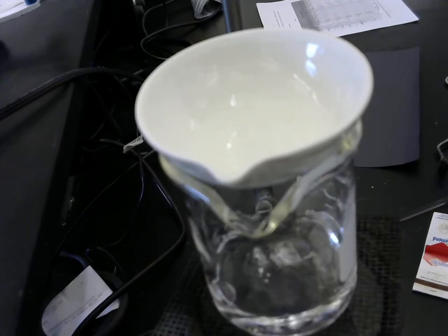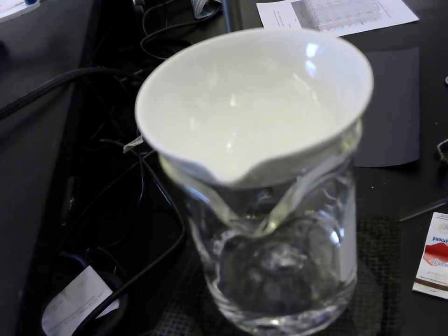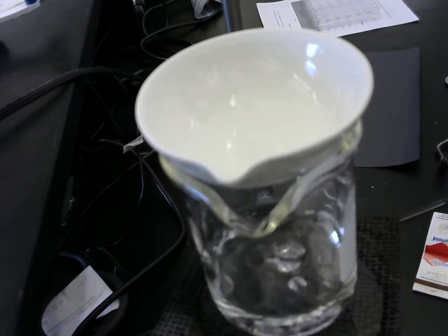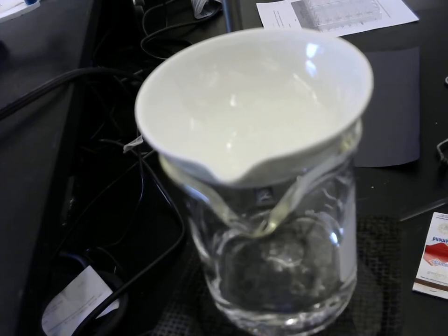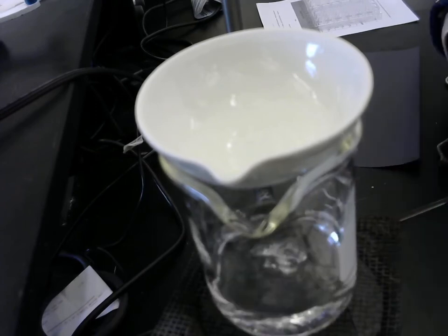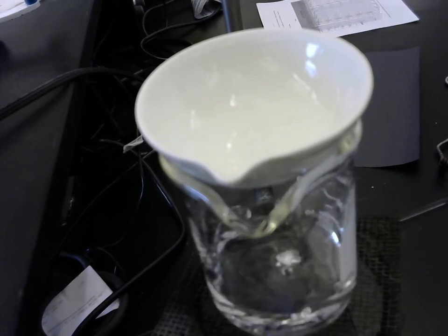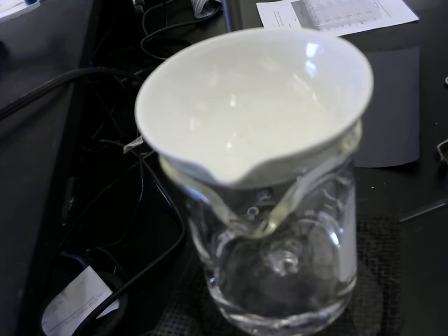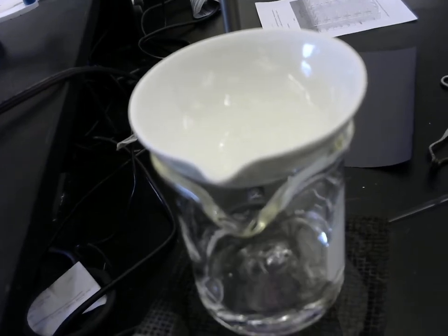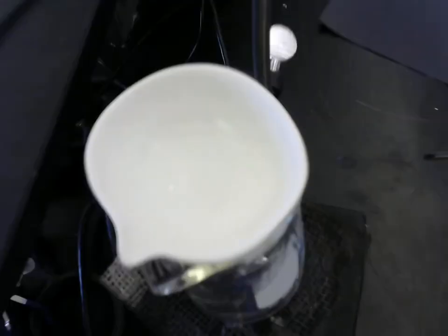You may be wondering why we don't just put the evaporating dish directly over the flame. We evaporate it this way for the same reason that you might melt chocolate in a double boiler. We want the evaporation to be slow and gentle. If we put the evaporating dish directly over the flame, it would all evaporate so quickly that it would sputter and we'd lose a lot of the salt. So I'm not sure exactly how much you can see. Let me try and give you a very direct view of what's inside that evaporating dish.